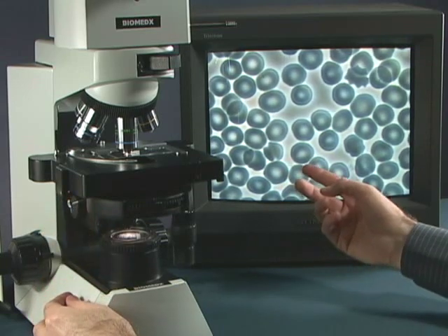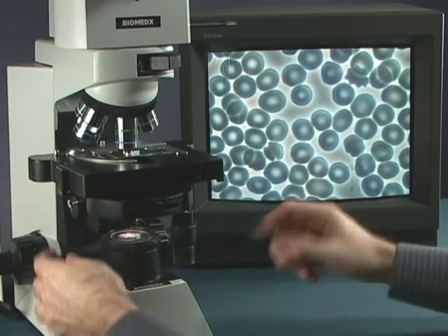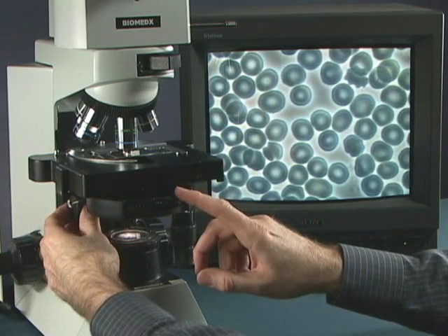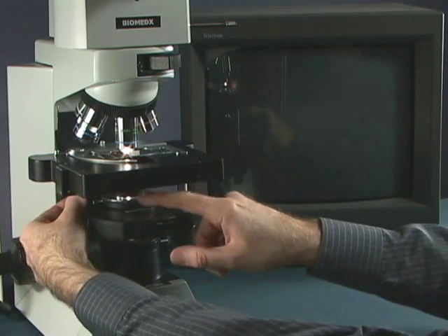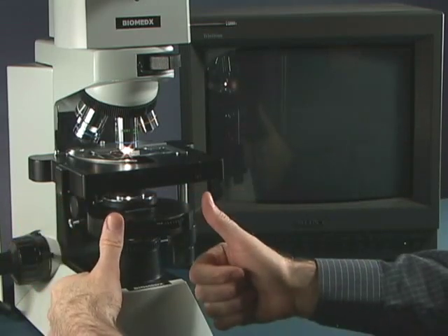You might get this image that looks like this. The condenser has to be seated properly in its holder, under here, it has to be seated all the way up.